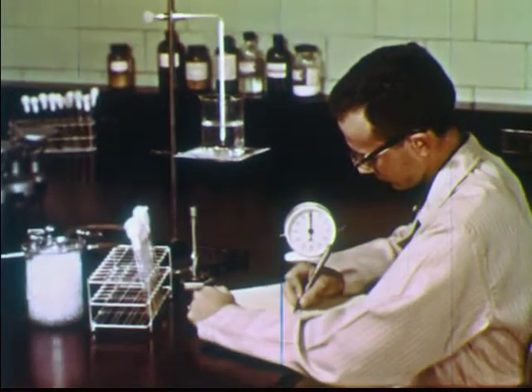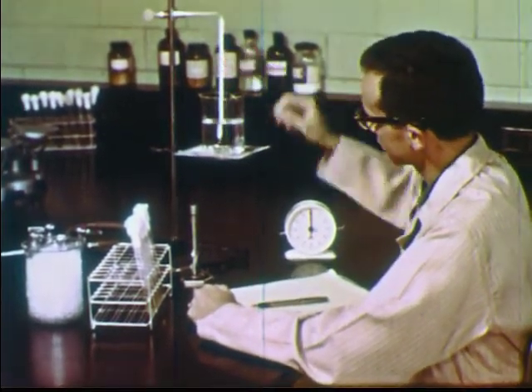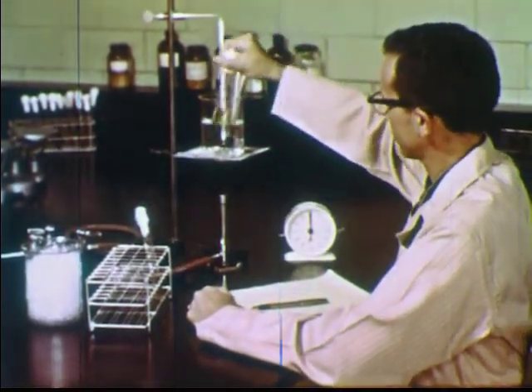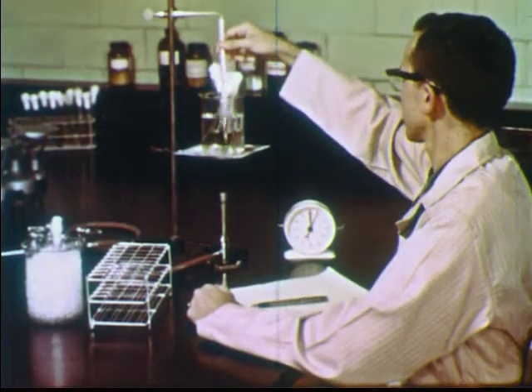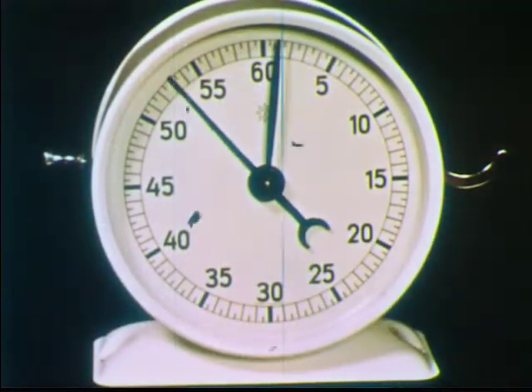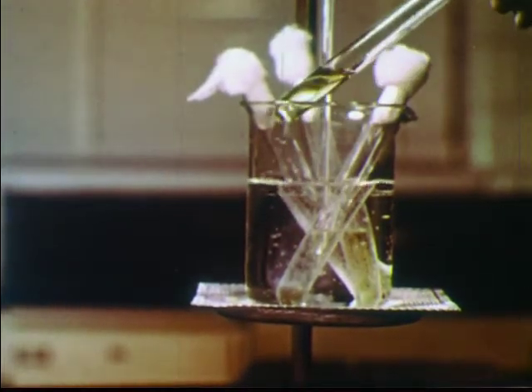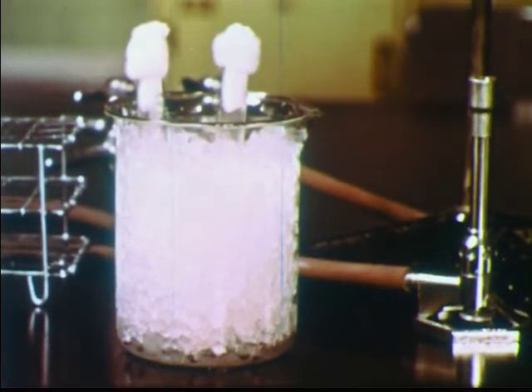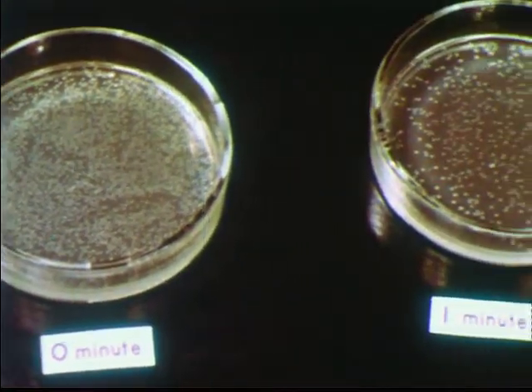With an understanding of the requirements for growth and metabolism of bacteria, it is possible to devise methods for their control. One common method of killing some bacteria is with relatively low heat. A series of inoculated tubes is heated at 60 degrees centigrade in a water bath. After various time intervals, individual tubes are removed and cooled in ice. The number of living bacteria in each tube, as determined by colony count, indicates that fewer cells survive with longer heating.